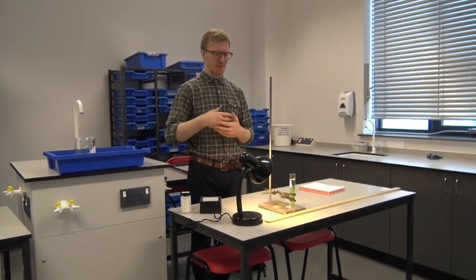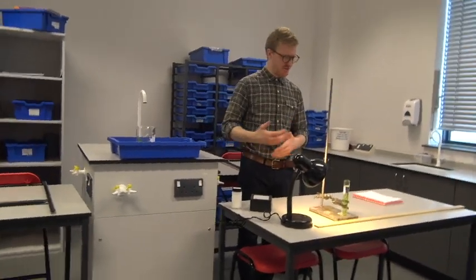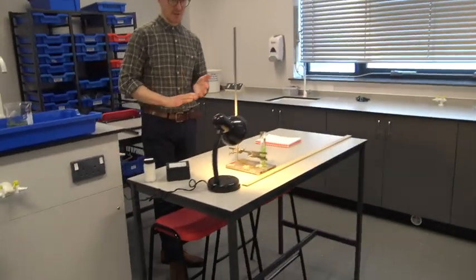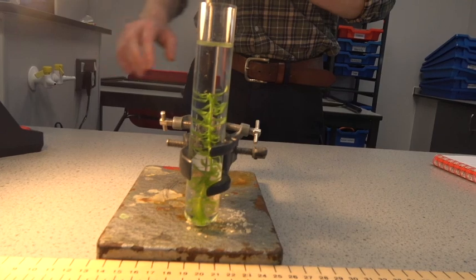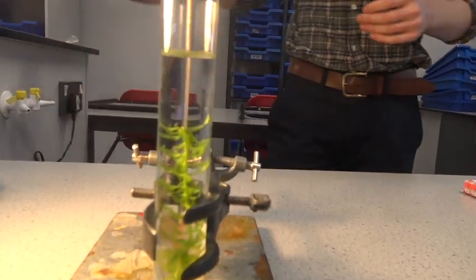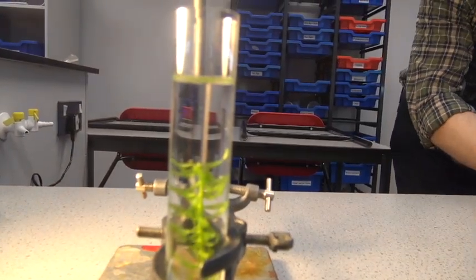So we've got the pondweed now starting to photosynthesize as we're getting this oxygen coming off the plant. So what I'm going to do is start our timer, and then I'm also going to start taking notes of how many bubbles we see over the minute.